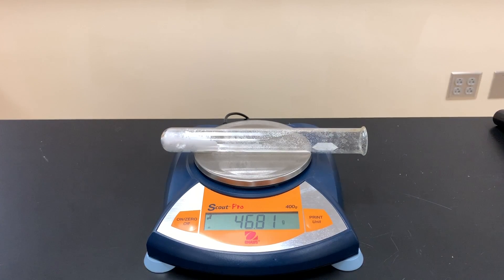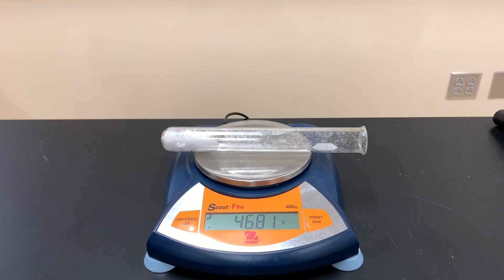The question is what is this sort of new white solid that looks to be the same as baking soda but it's not. So we get 46.81 grams. So then the next thing you're going to do is move on to the calculations in the lab to try to prove the identity of all three products, especially this solid that is white left in the test tube.